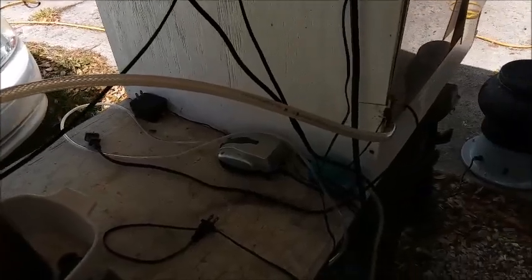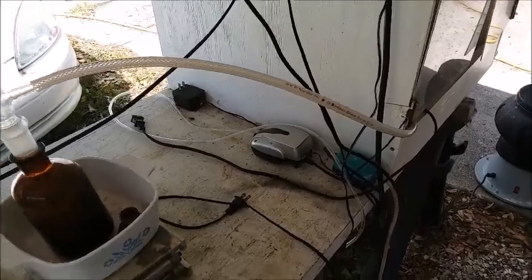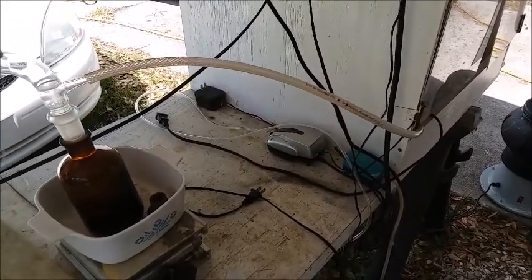I've got the hose running into my homemade fume hood over here to get rid of the nitrogen dioxide gases that bubble off.